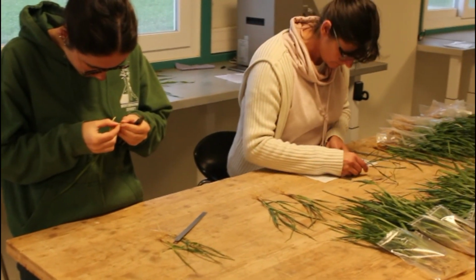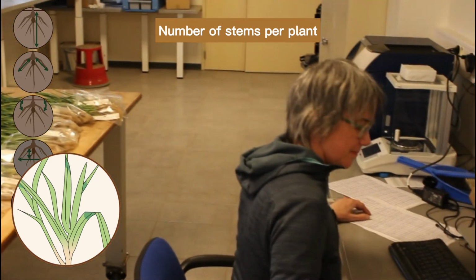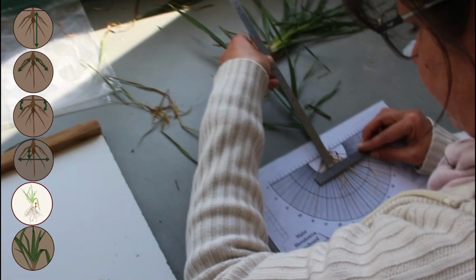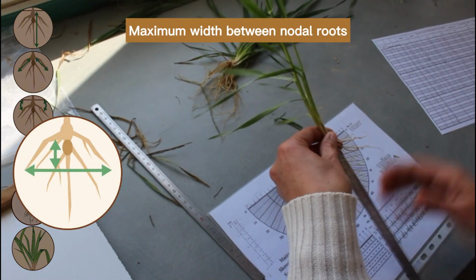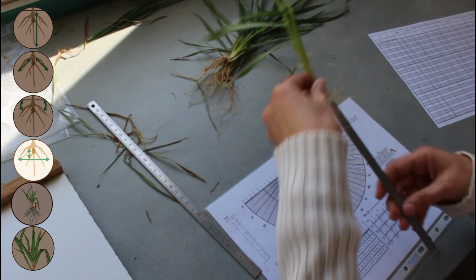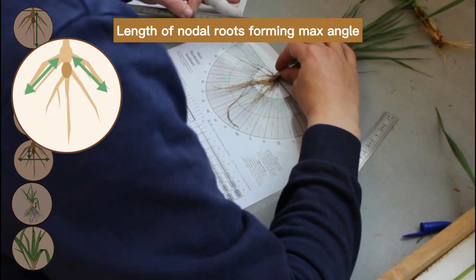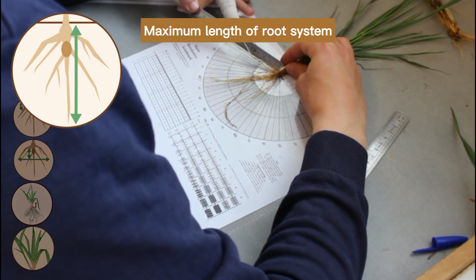The simplified method involves noting the number of stems per plant to estimate tillering density, the height of the white section on the stem, which gives access to the depth of the underground part of the plant, the maximum width between the nodal roots, the depth at which this maximum width is found, the root angle of the nodal roots, the length of the nodal roots forming this maximum angle, and the maximum length of the root system.